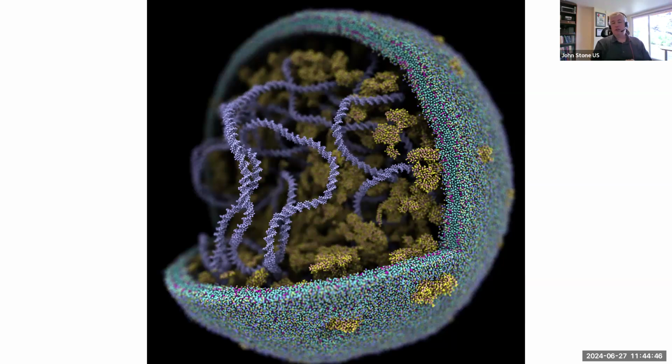This and the nomenclature stuff, this is often one of the things that makes it hard with different people's data. If a friend or a colleague sends you their simulation and you want to visualize it or study it yourself, often it is the way they've chosen to name things. It was meaningful to them. It may or may not be meaningful to you. Those things end up being more of your challenge than the use of the software, at least in my mind.